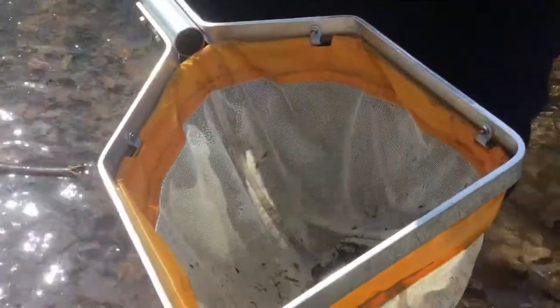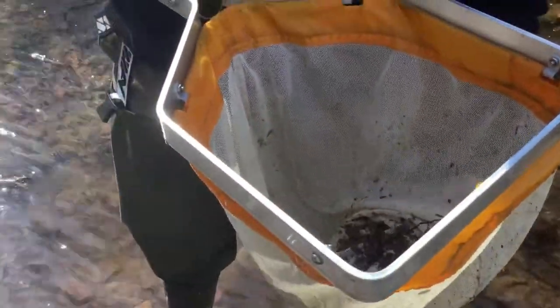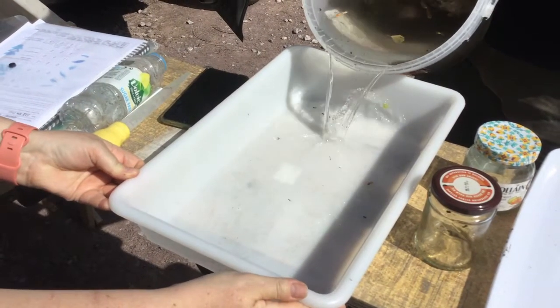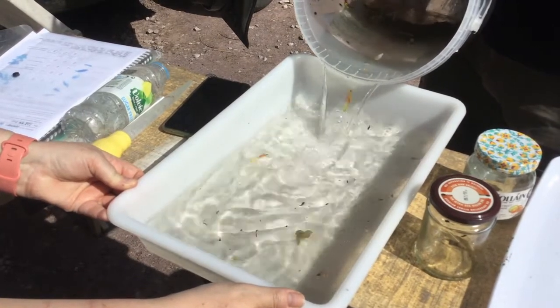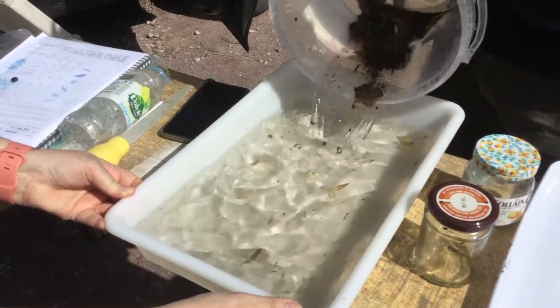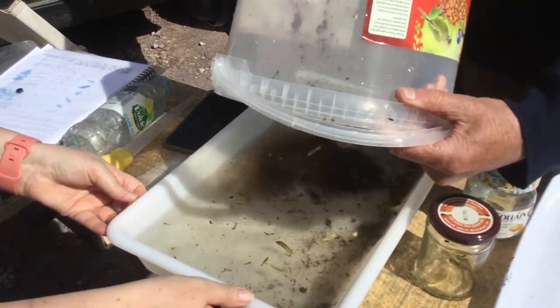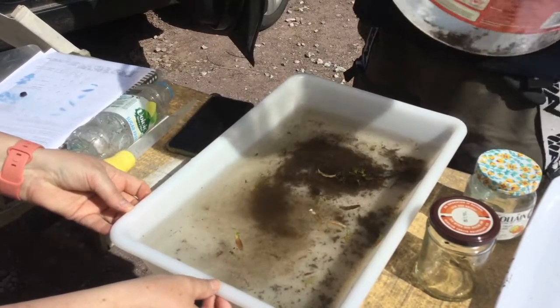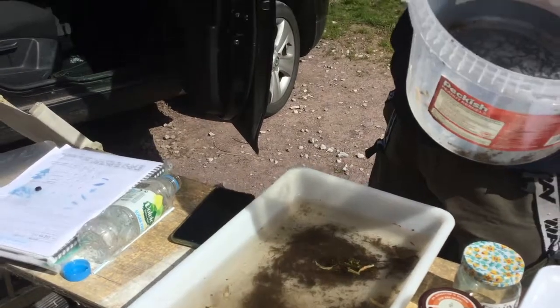The fecundity of this river is fantastic. Let's slowly transfer that. Now we'll have to get rid of quite a bit of this water - I think we'll put that in there and let it settle for a minute. Now, an absolutely fundamental piece of equipment: the turkey baster. An industrial turkey baster.